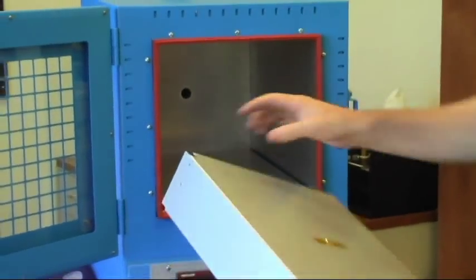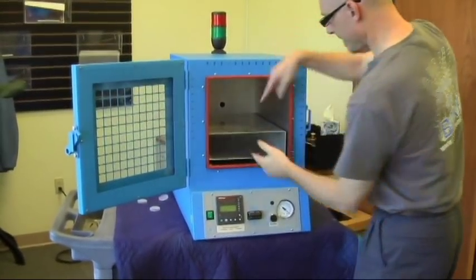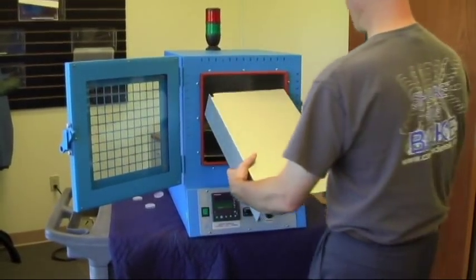There's a little notch provided in the back if you're running wires or anything, to help you get them up and down through the shelves, and these just sit on top of each other.